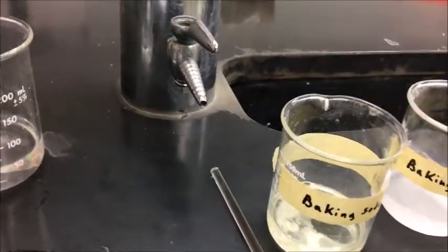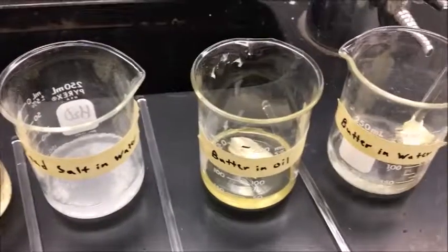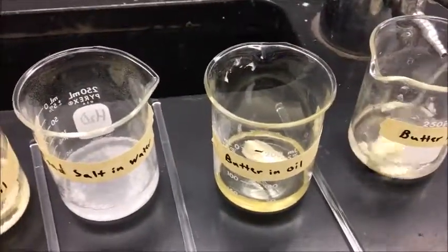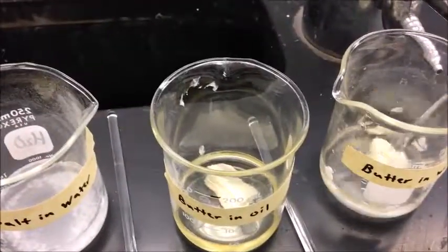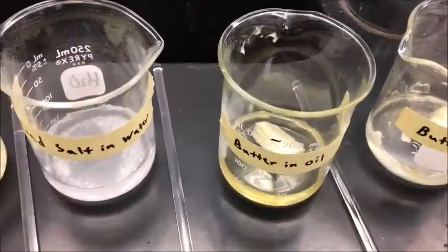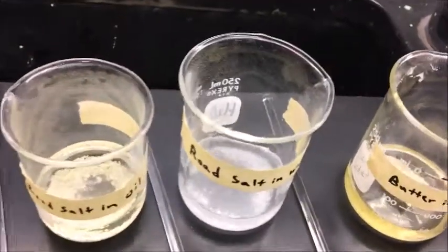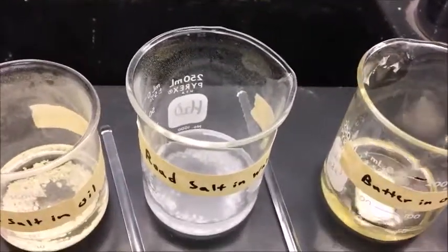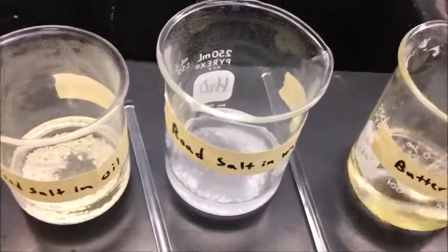So then what we do is we observe what happens to these chemicals. And we use a stirring rod appropriate to each one to mix them up and see if we can get results here. To see if the substance, fat in this case being butter, does it disintegrate when it's in water? What does it do exactly? Same question, when we put it with oil, does it disintegrate, or basically is it soluble? Okay, so we mix it up a little bit, see what happens, give it a couple minutes here.